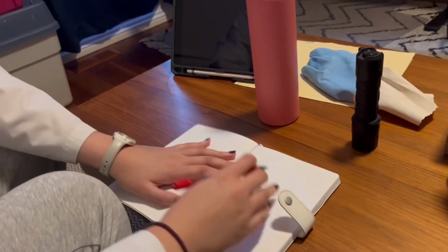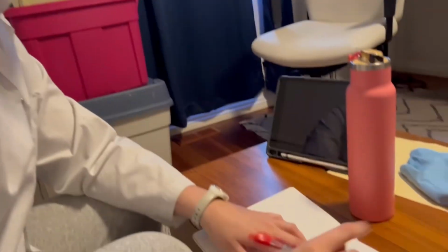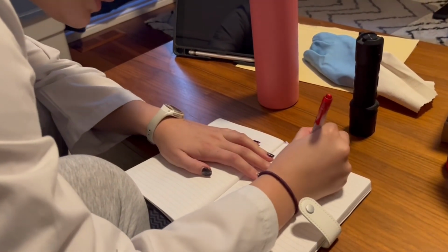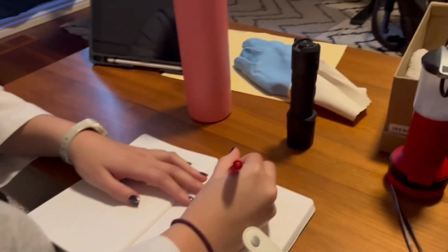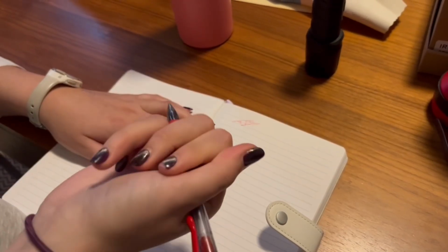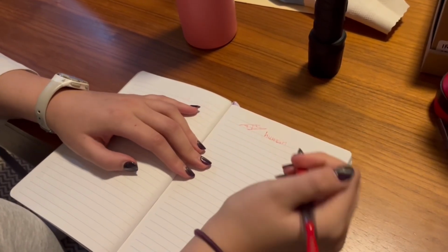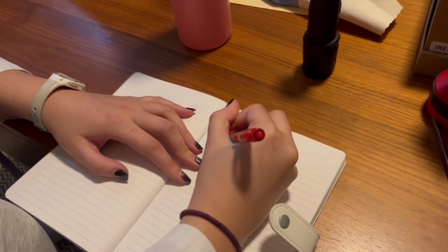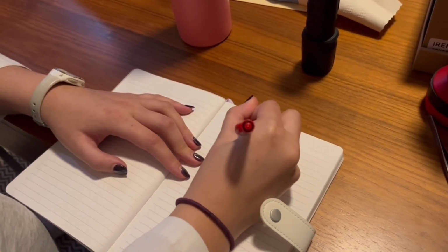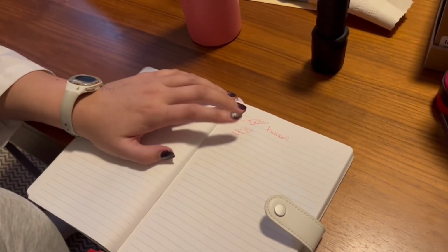Okay. So after looking with my microscope at the hair, I can tell you that it's human hair because human hair looks like this. It's long, and it has craggly lines and different texture. So this is human as opposed to animal hair, which would be more like this, more porous with more crown-like texture. That's one kind of animal hair.